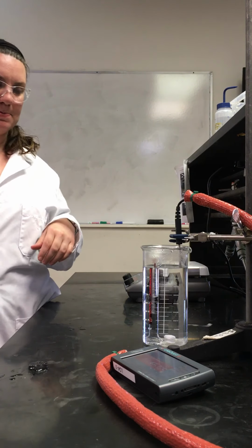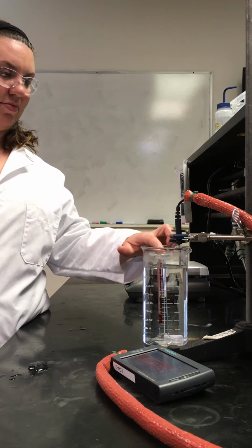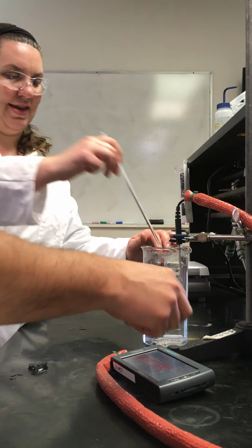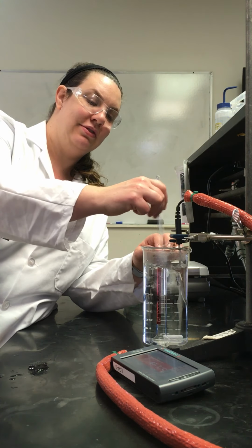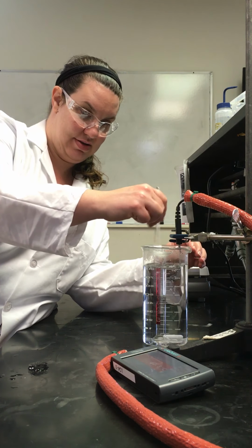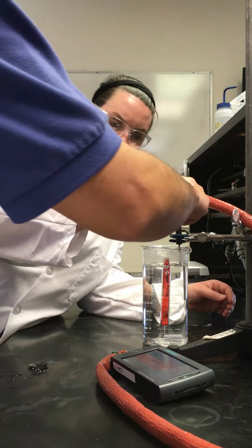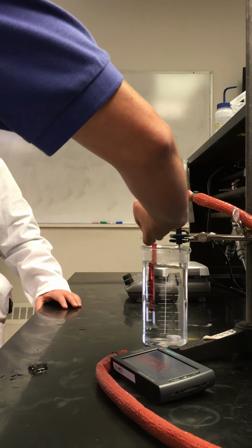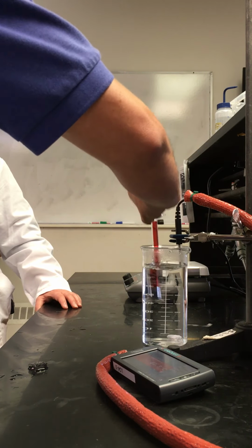Okay. More ice. Oh, that's too much, probably. Well, you need more ice as you get further down. True. Oh, that looks like a perfect amount. Actually, it did. It's like hotter up top than at the bottom here. Yeah.